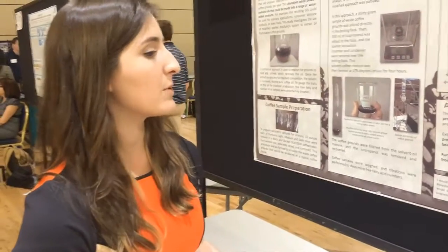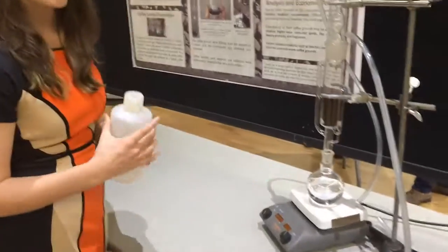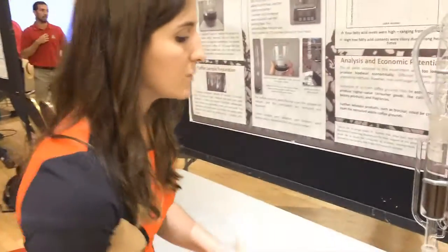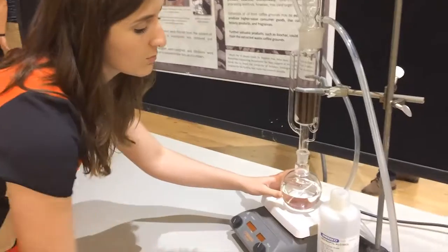Overall, what I was using for most of the experiment was a Soxhlet distillation, where I was using a polar solvent, isopropyl alcohol, and it was placed in the bottom bulb of a Soxhlet distillation system right here.